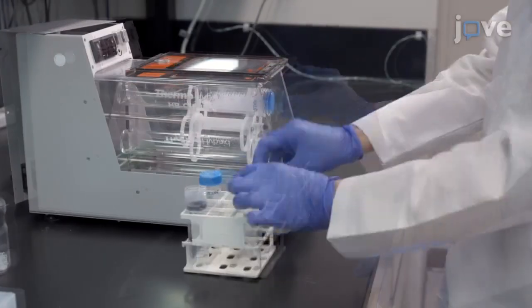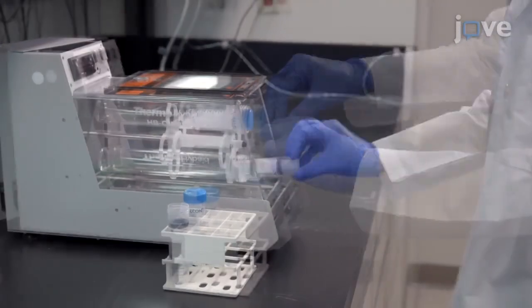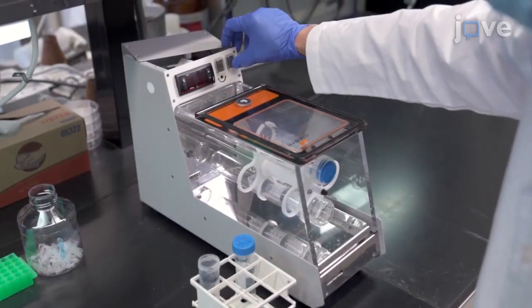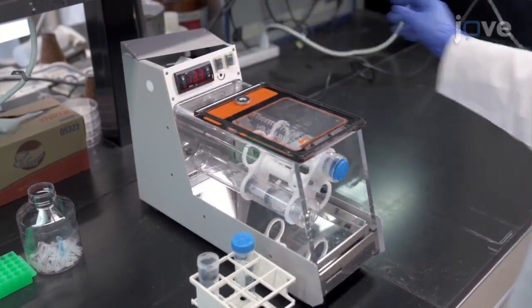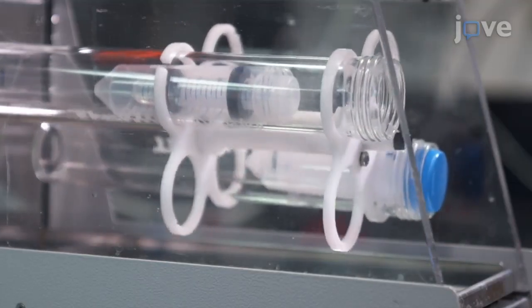Insert the tube into a glass bottle for the hybridization oven and turn on the oven. Incubate the membrane with 6 RPM rotation for at least 5 minutes.